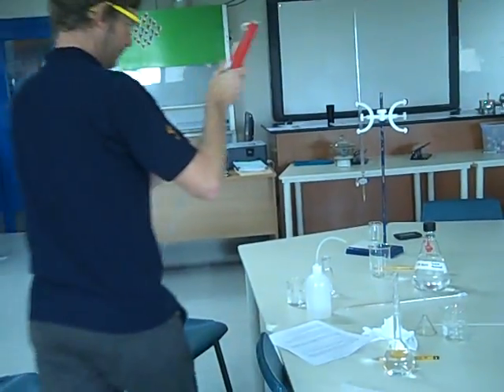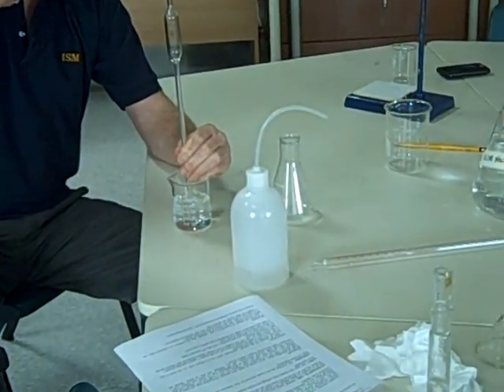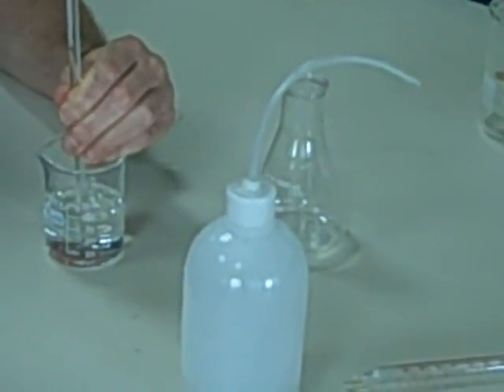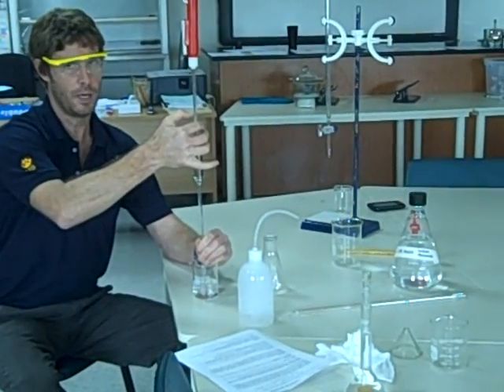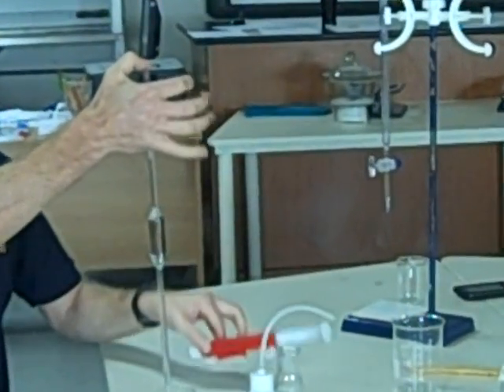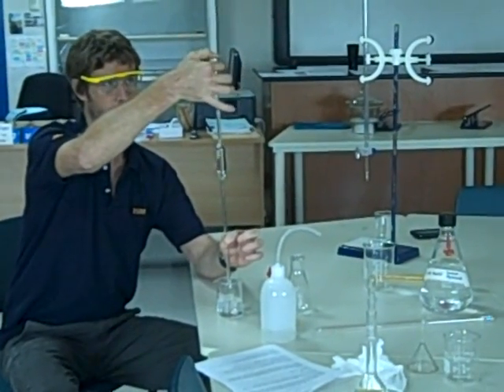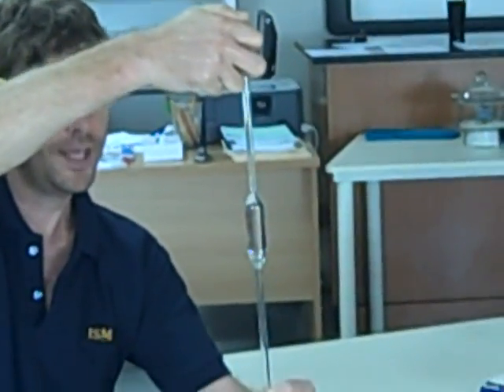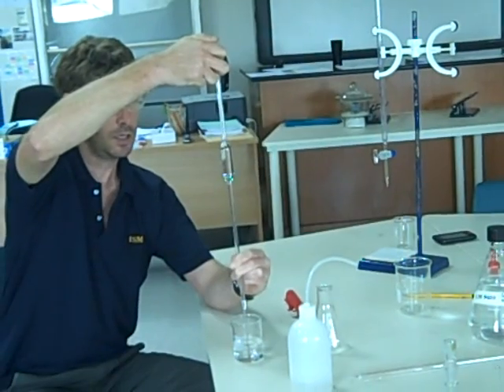Pull down, and then, putting the tip of our pipette under the surface, but not on the floor, we bring the sodium hydroxide up. And I will always make sure it goes past the gradation mark, because then what I will do is very carefully slide my thumb up and put my thumb over the top, so I've now got just more than the 25. Evolution has created our thumbs with a thumbprint, which allows us to control the exit of water from here very carefully, drop by drop, until the bottom of my meniscus is right on the level. And I did that correctly.